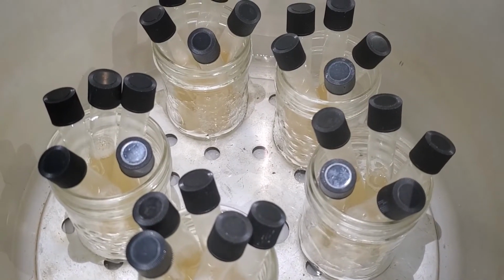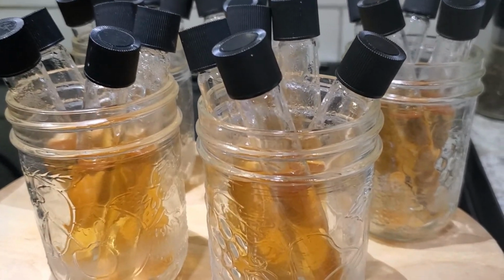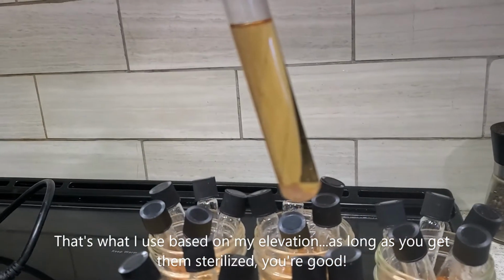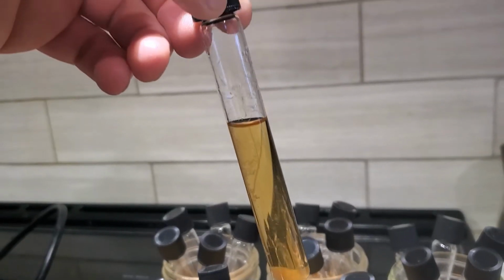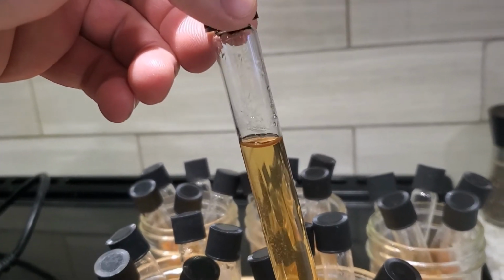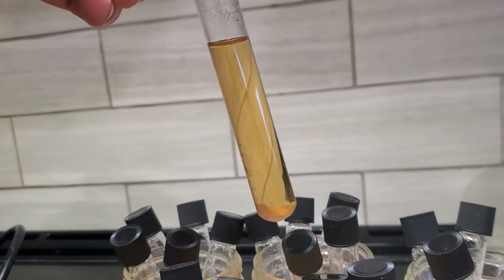And we are heating up. So after 15 minutes at around 14 pounds of pressure, you have these completely sterilized, beautiful vials ready to be inoculated with yeast. So I'm just going to take these, I'm going to refrigerate them, and they'll be awaiting an inoculation of yeast at some point.